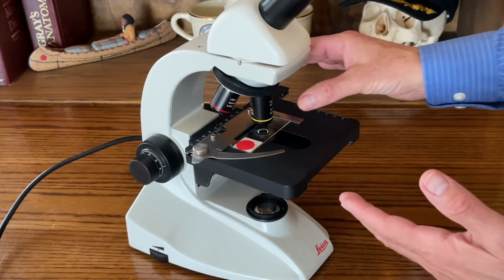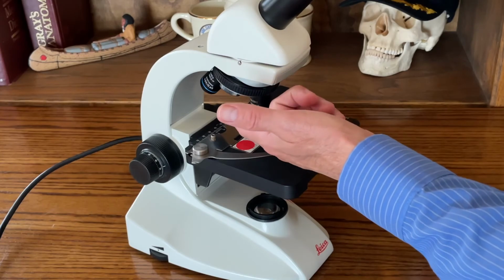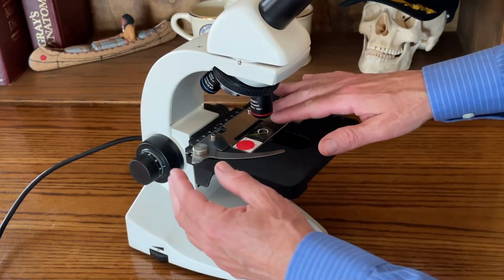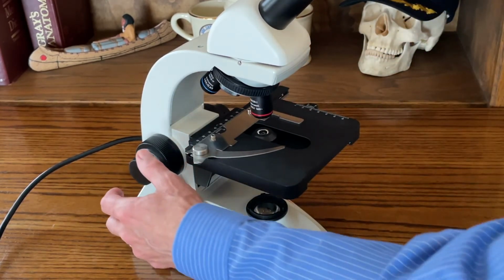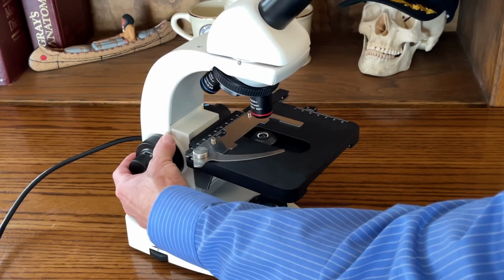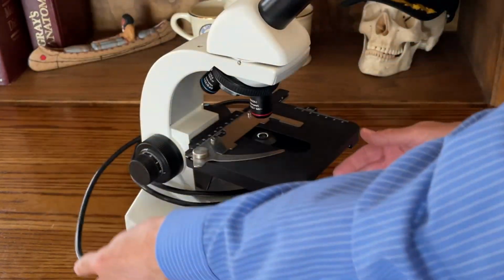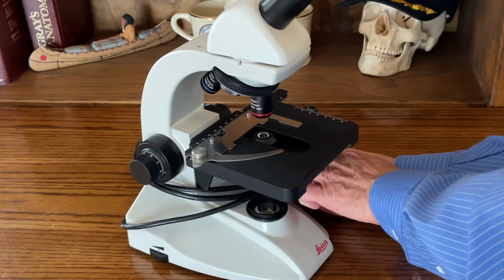Finally, at the end of lab, you always want to turn your nose piece to the lowest position, lowest power lens, or even this 4th position, which is often vacant because it's used for oil immersion. But if not, then use the lowest power lens, turn it to that position, remove your specimen slide from the stage, and then ultimately turn the stage to its lowest position, dialing it down with the coarse adjustment, just like that. Finally, take the cord and wrap it around the base of the scope for storage, and then place the scope back in its proper placement in the microscope cabinet.